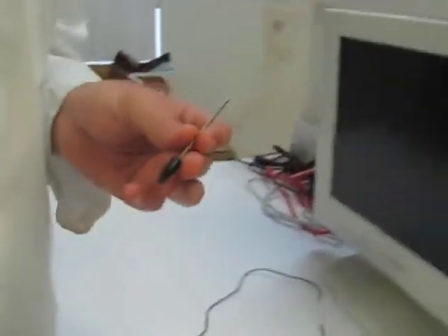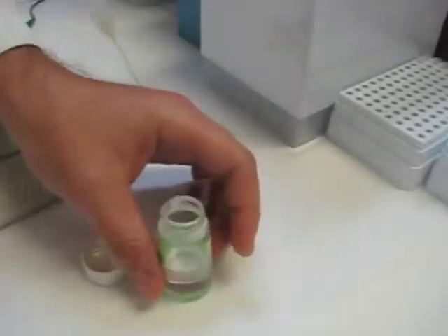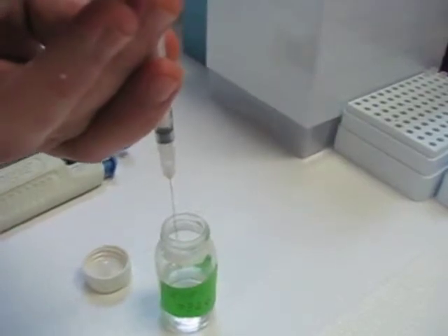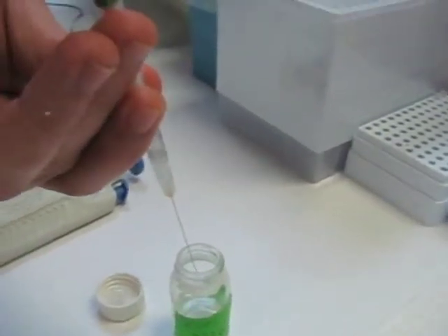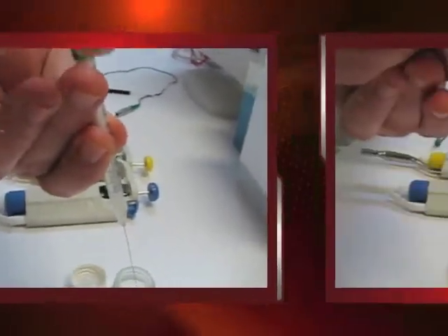Now I will take a syringe and filling solution. I will set the sleeve down while I fill the syringe. Make sure you put the syringe far enough down into your vial so that you don't get any air. And since I'm only doing one sleeve, I'm going to take just a little bit. Now I will remove this.